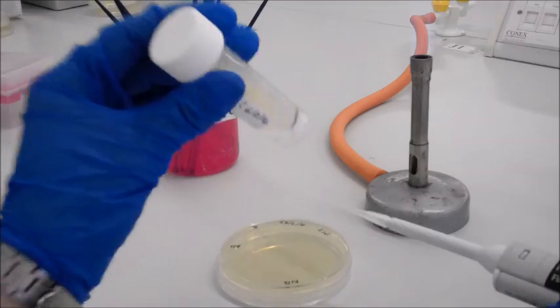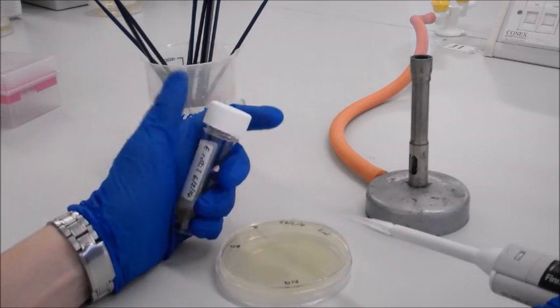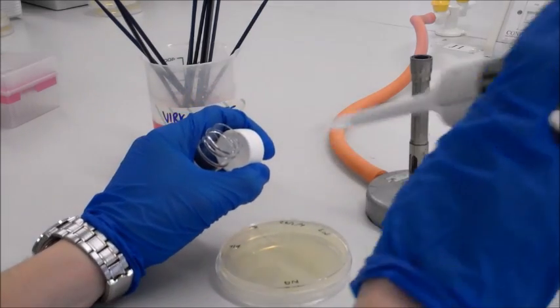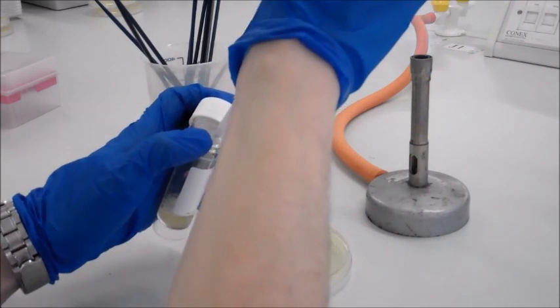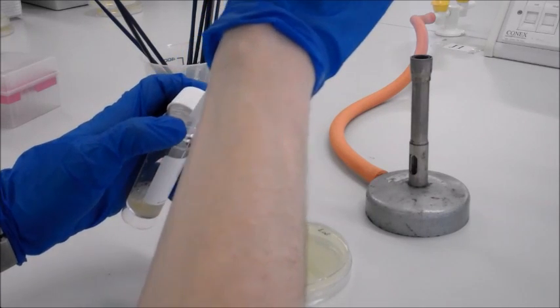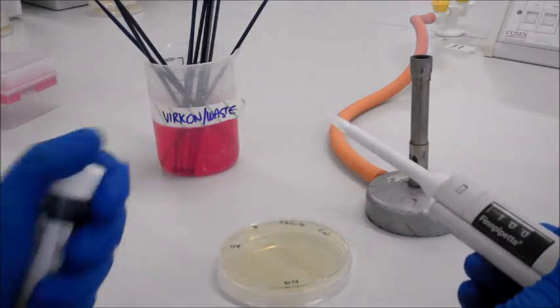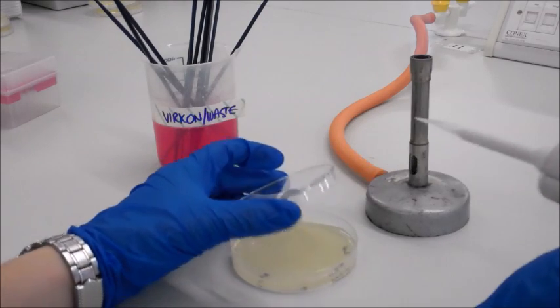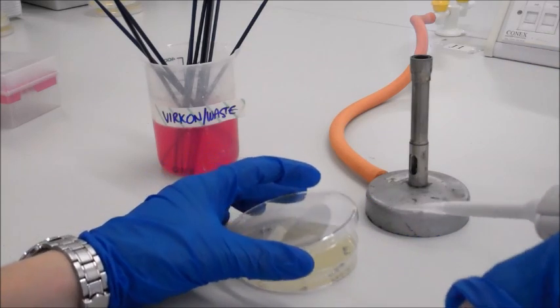don't rush it. Using one hand, unscrew the cap of the culture bottle and hold it with the same hand. You can then draw up some culture with the pipette in the other hand. As soon as you have got the culture, put the cap back on the bottle. Lift the lid off the plate as little as possible and transfer the culture onto the plate, replacing the lid as soon as you have done this.